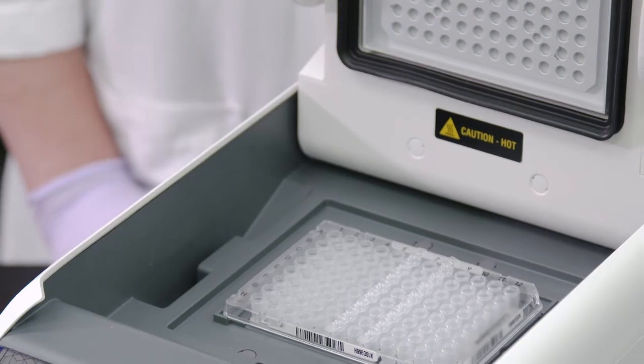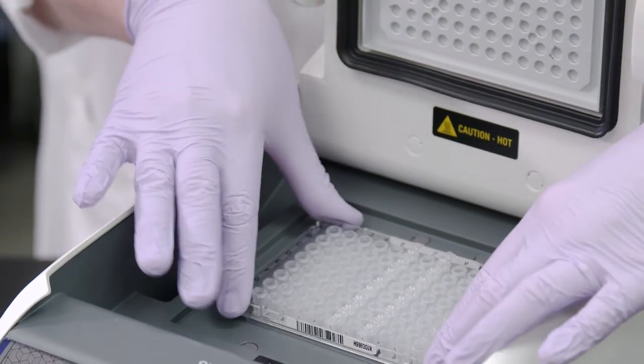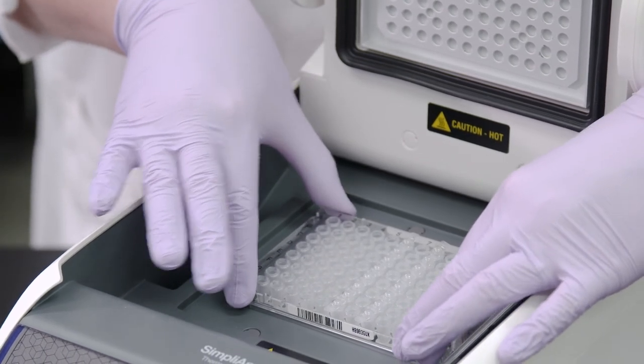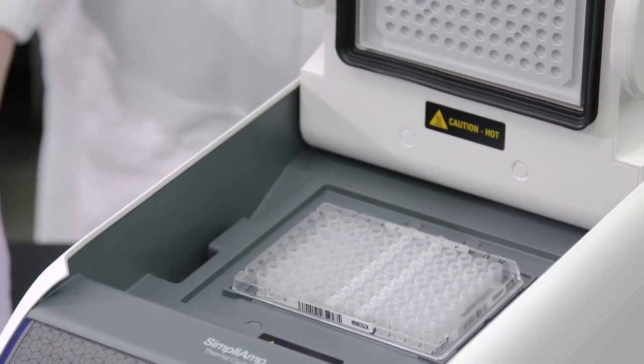Occasionally, a PCR plate will become jammed or stuck to the sample block after the heating and cooling of thermal cycling. The multi-removal tool will solve this problem with ease.